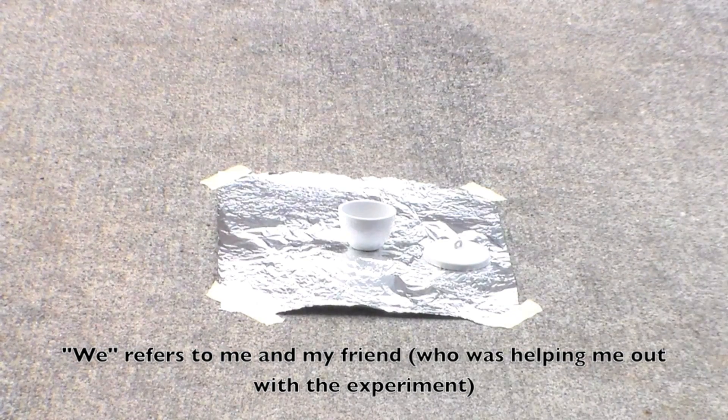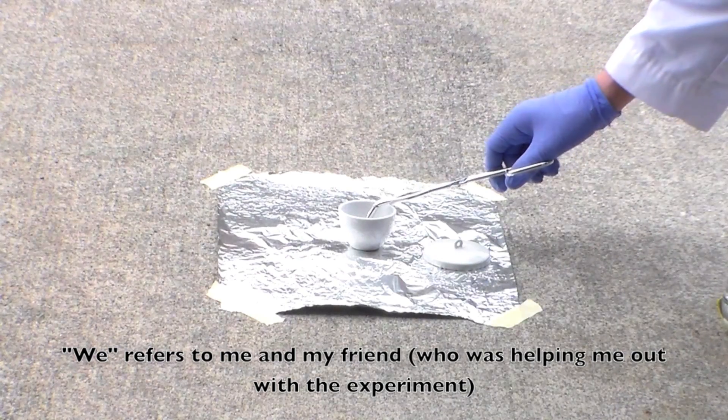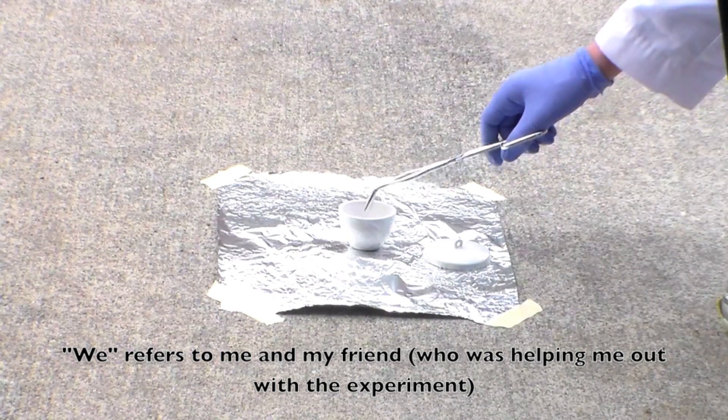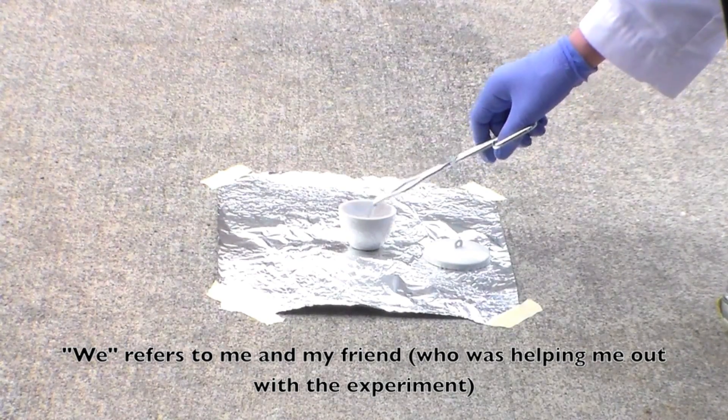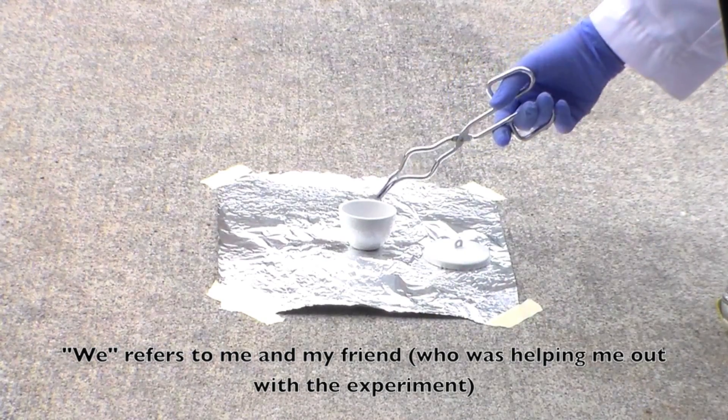And I looked at it, I got close and looked at it, and there were some small specks in there that were burning. And then with some agitation, it all started burning again.